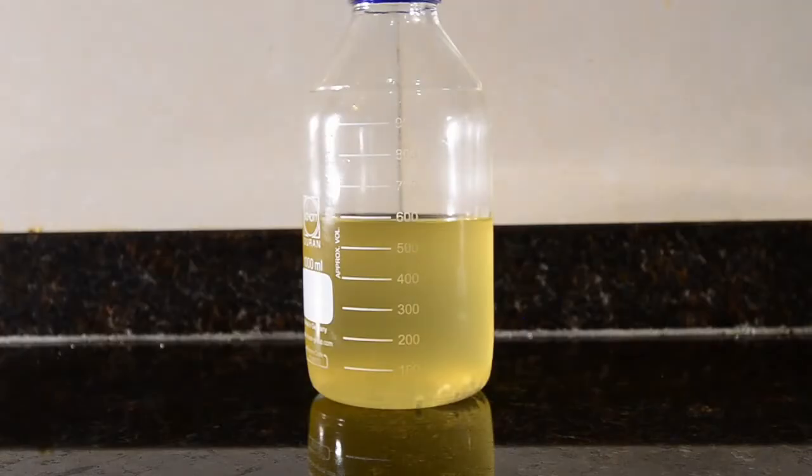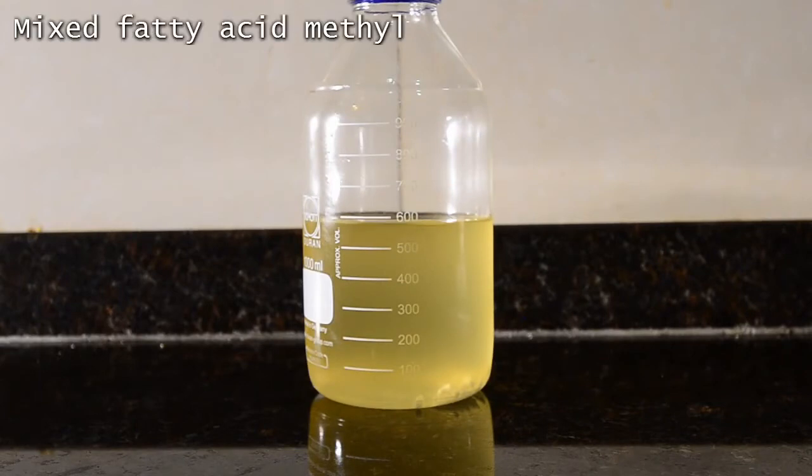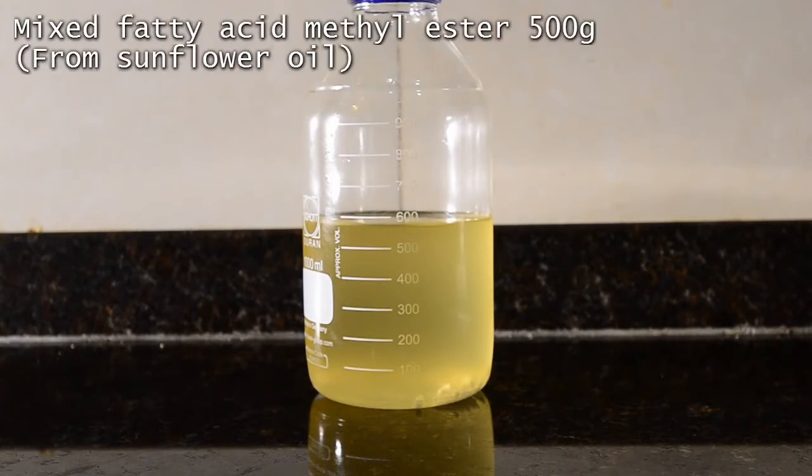And here's the product. 500 grams of methyl fatty acid ester, otherwise known as biodiesel. It's still slightly cloudy so it needs to be left to dry a little more.